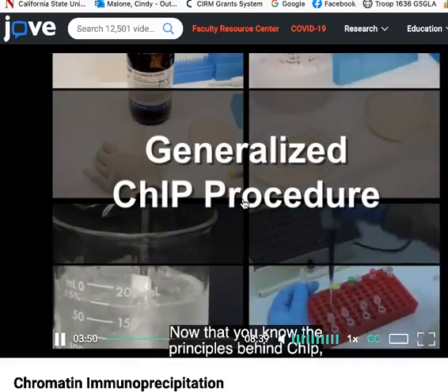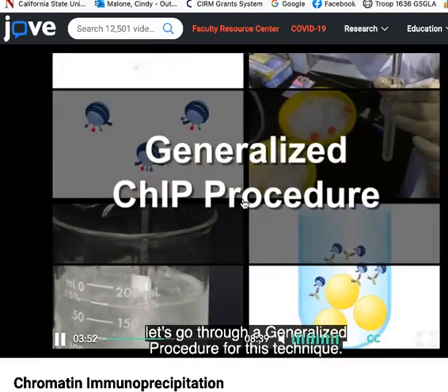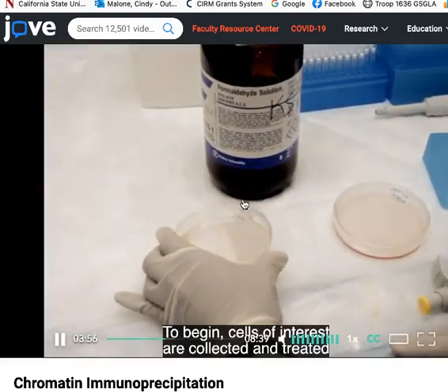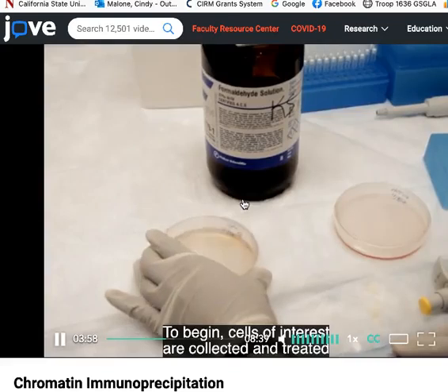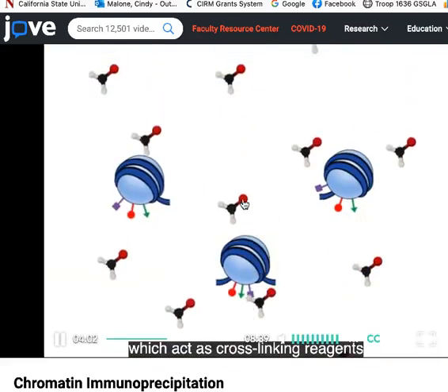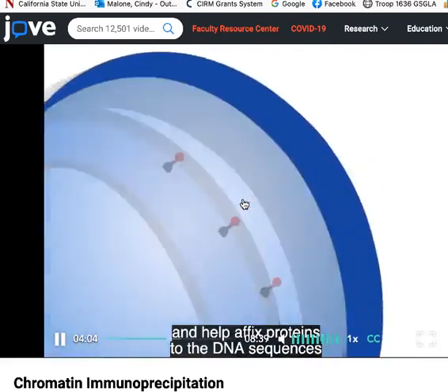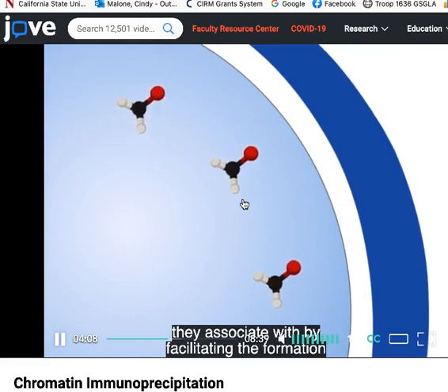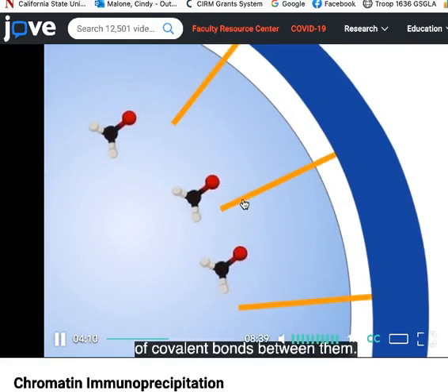Now that you know the principles behind ChIP, let's go through a generalized procedure for this technique. To begin, cells of interest are collected and treated with chemicals like formaldehyde, which act as cross-linking reagents and help affix proteins to the DNA sequences they associate with by facilitating the formation of covalent bonds between them.